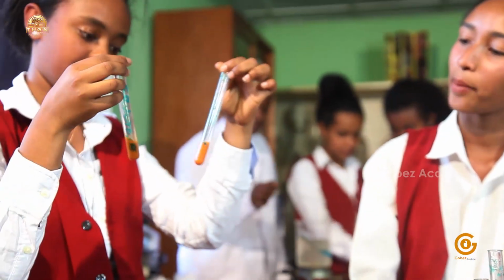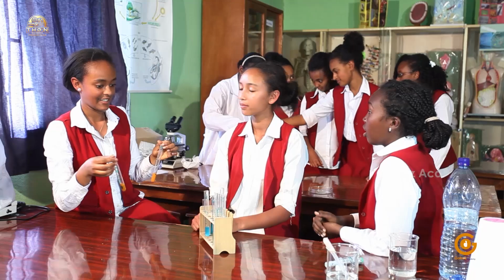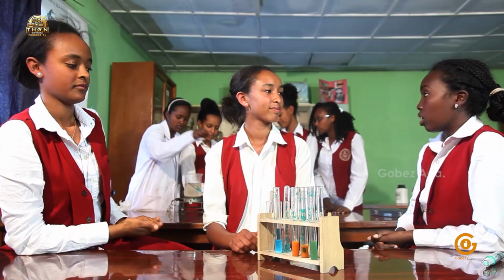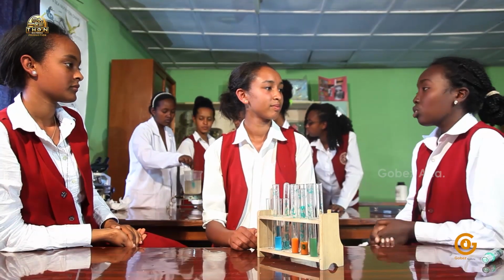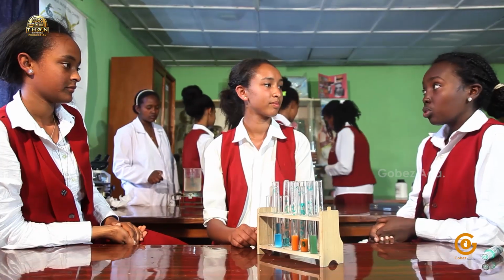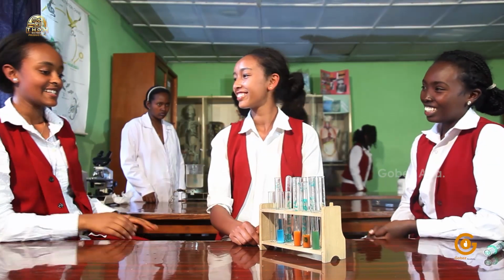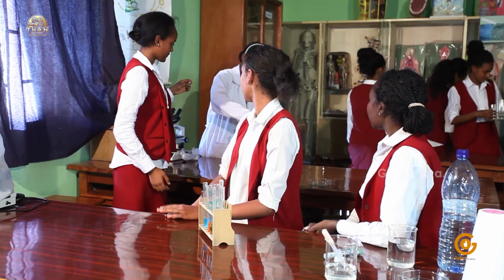Oh yes. But could you please explain to me why there is a change in color? I have read in our textbook that the Benedict solution contains copper 2, and monosaccharides reduce copper 2, which is blue, to copper 1, which is orange. Monosaccharides give electron to copper 2. That's why monosaccharides are called reducing sugars. Thank you. So now let's check the control and see if there's any kind of color change.